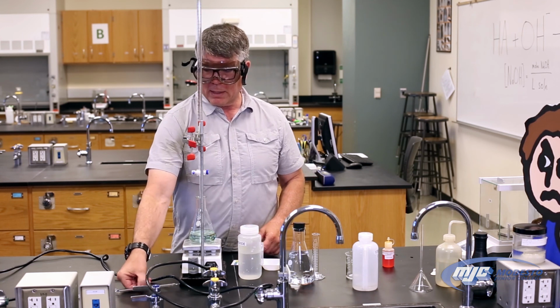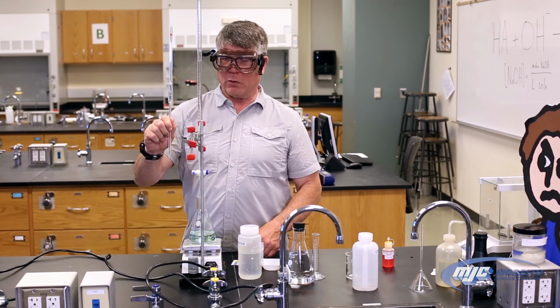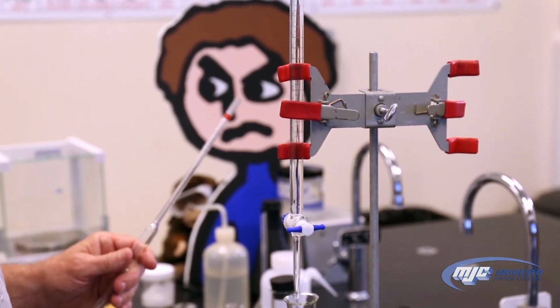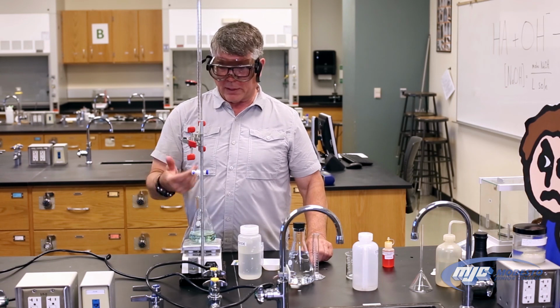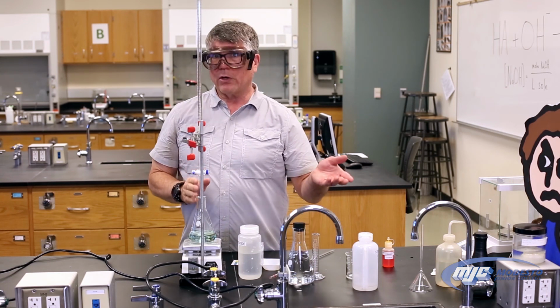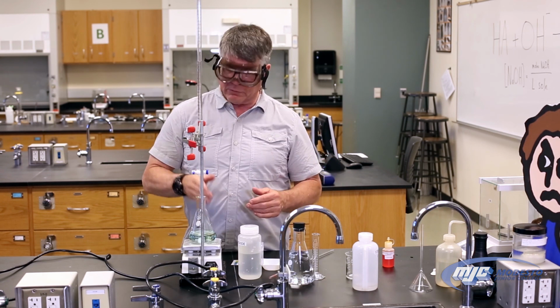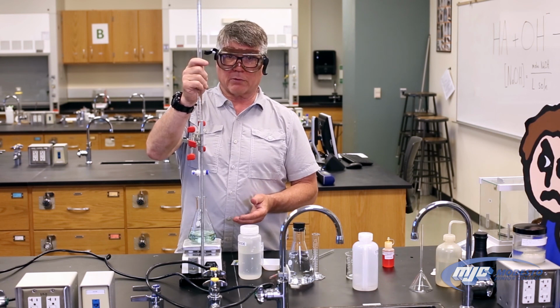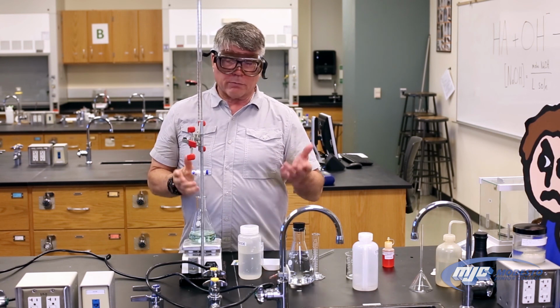The difference being that we measure out 10.00 milliliters with a volumetric pipette into the flask. But same thing, add the indicator, titrate with the sodium hydroxide up here. And then the unknown we weigh out about 0.5 grams into each of the flasks, water, indicator, titrate it with the sodium hydroxide from here. And that's really all there is to it.